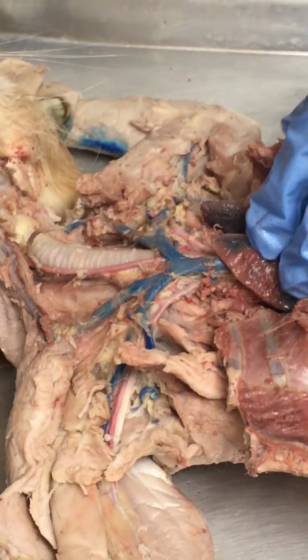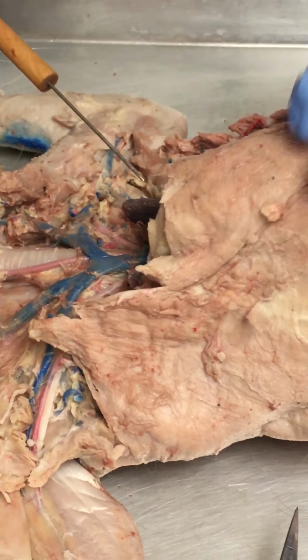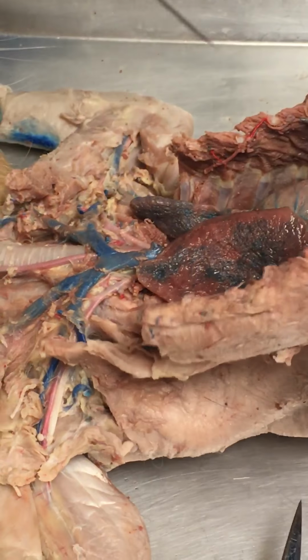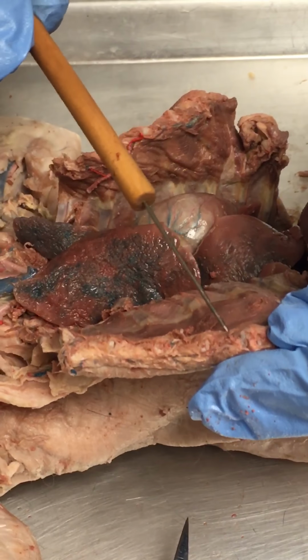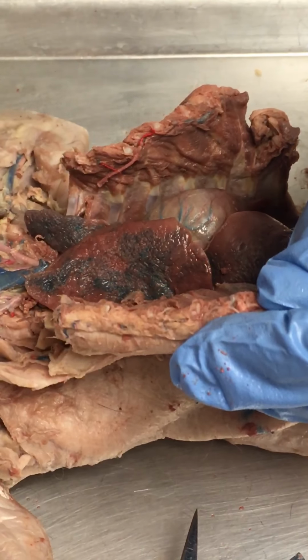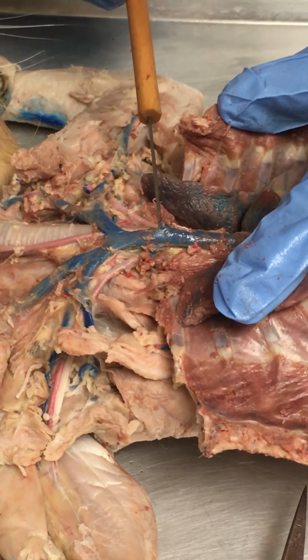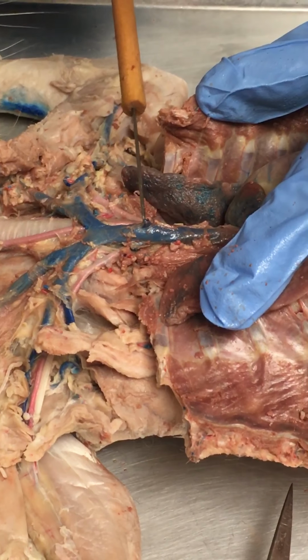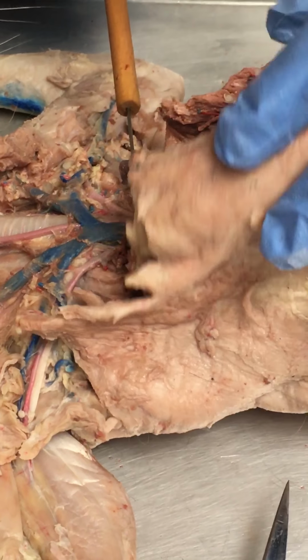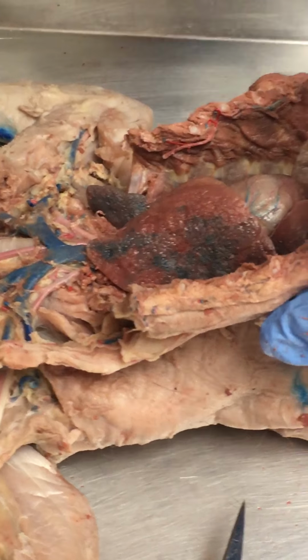The sternal vein: this cat has largely had its sternal vein removed, and this happens just in the cutting process. Occasionally we'll have some residual sternal vein running along the sternum here, and I suspect somebody's cat out there will have it. We do have the point at which it begins. So that would be the beginning of the sternal vein, and in the cat it would have run up to the sternum, and then it would have run down the length of the sternum. So that's the sternal vein.